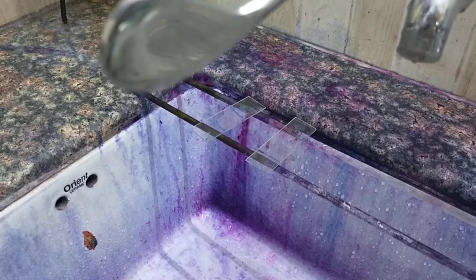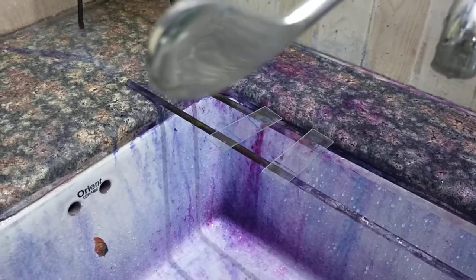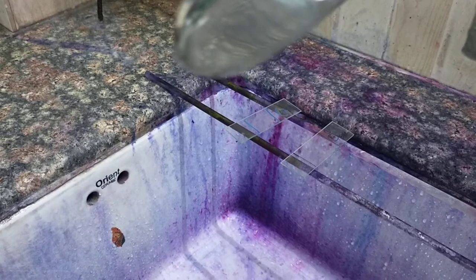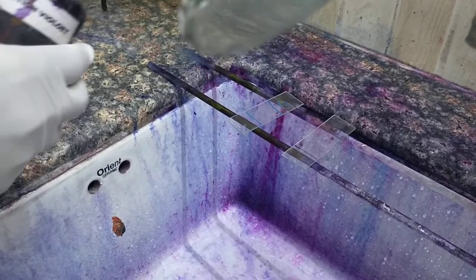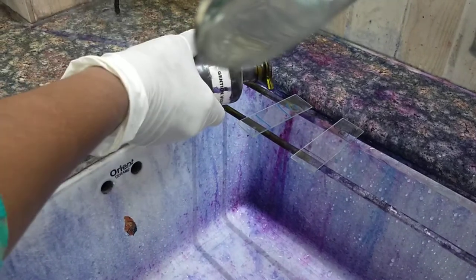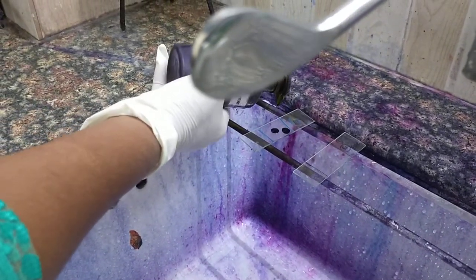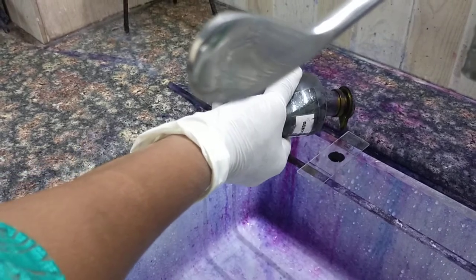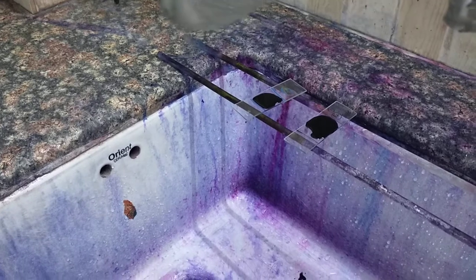Good morning all. Today we will see how to do the Gram staining. Such slides will be provided to you. First we will put crystal violet or gentian violet for 1 minute. As you can see on the smear, we are putting the gentian violet or crystal violet. You have to keep this for 1 minute.